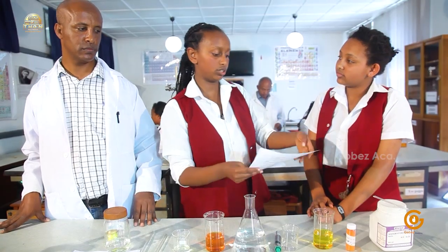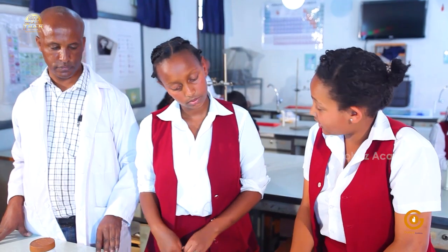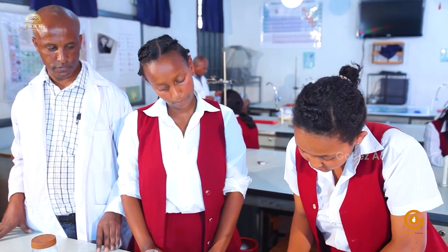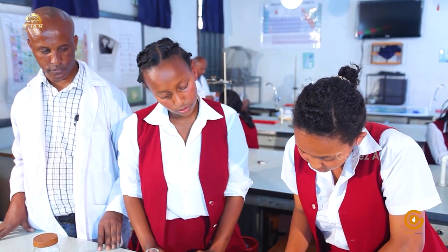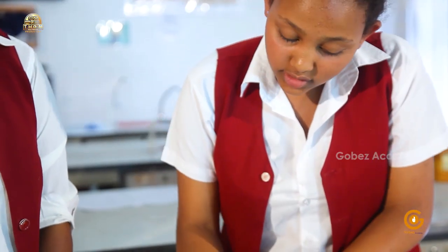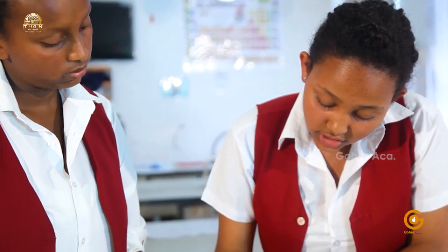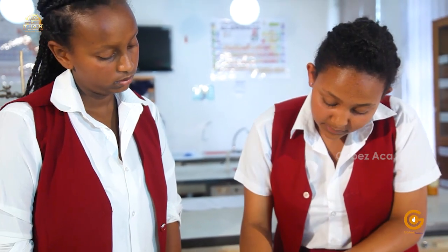So, what about yours? I had a dichromate originally, and it reacted with the hydroxide ion from my dilute base, and it was changed to chromate.